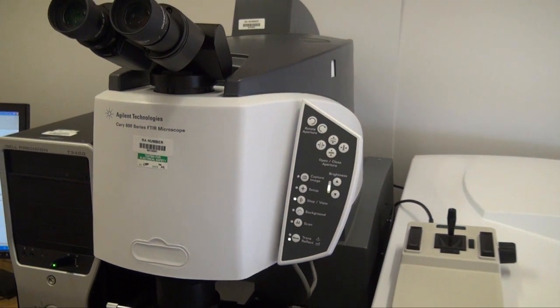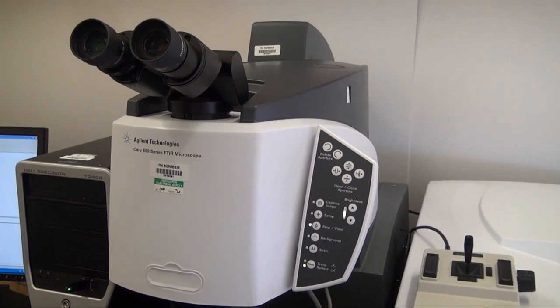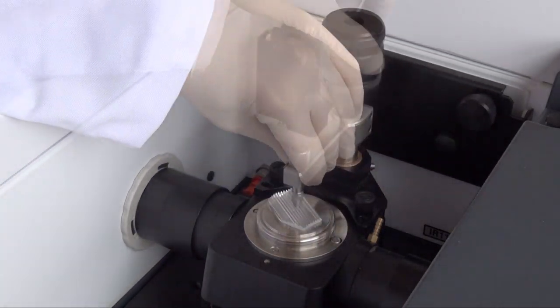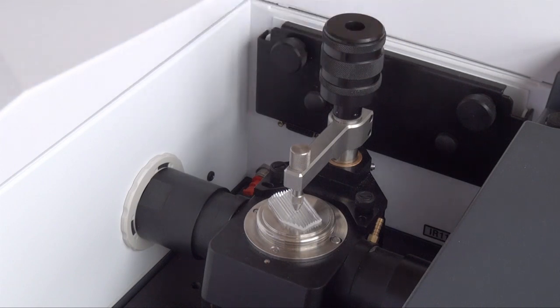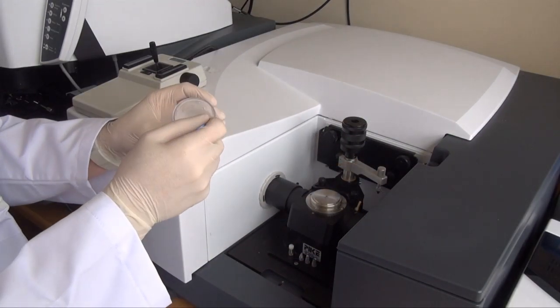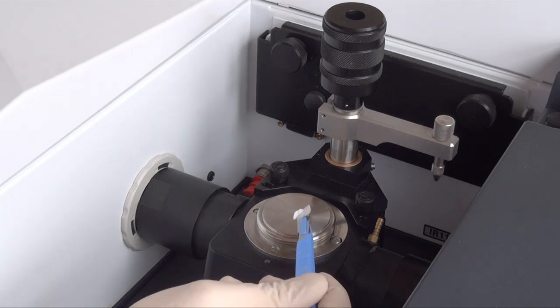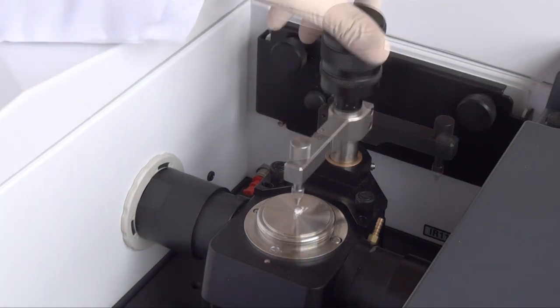A particularly important application is the identification of foreign bodies reported from food, such as this fragment of plastic. The plastic is placed over the diamond window of the device and pressed down to achieve very close contact with the diamond. This close contact is essential for the system to work.